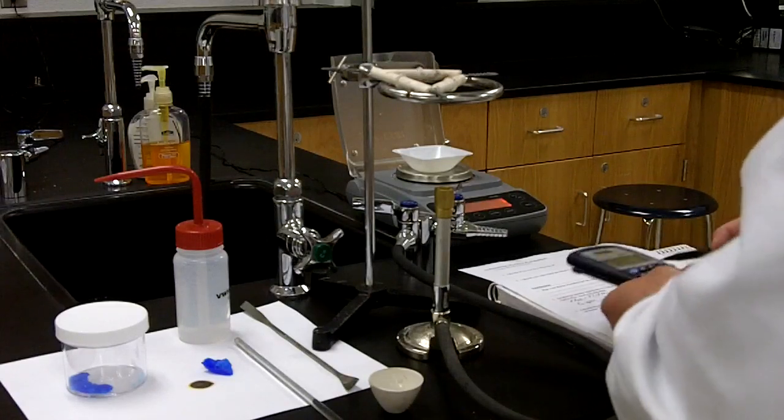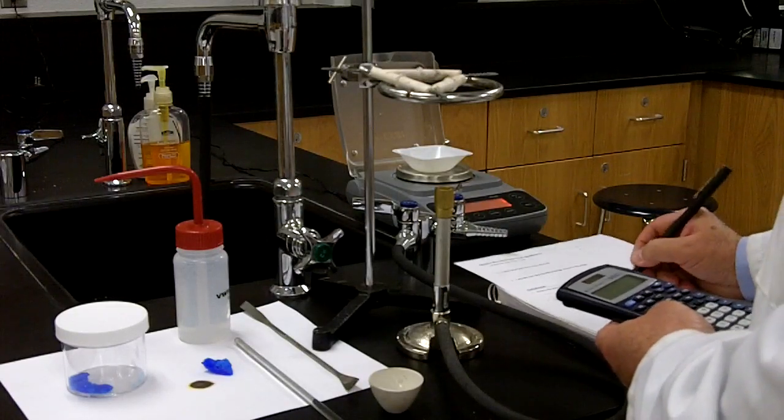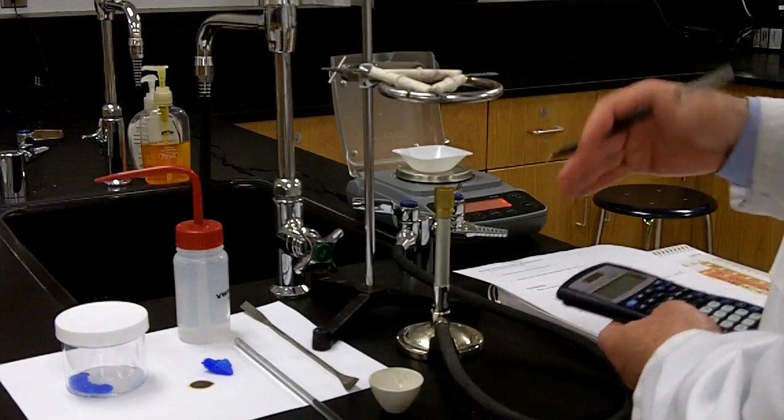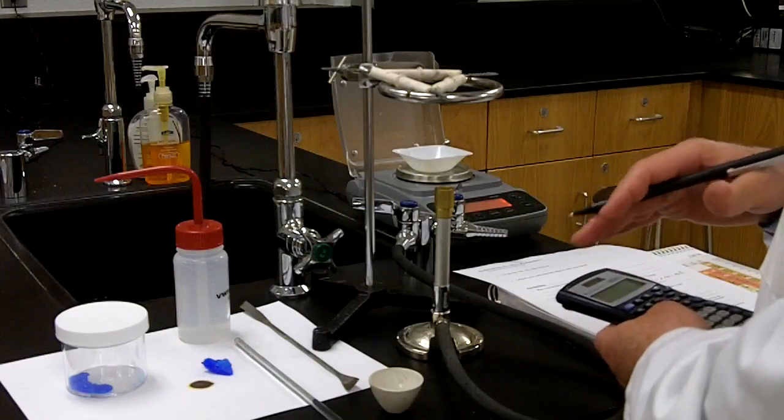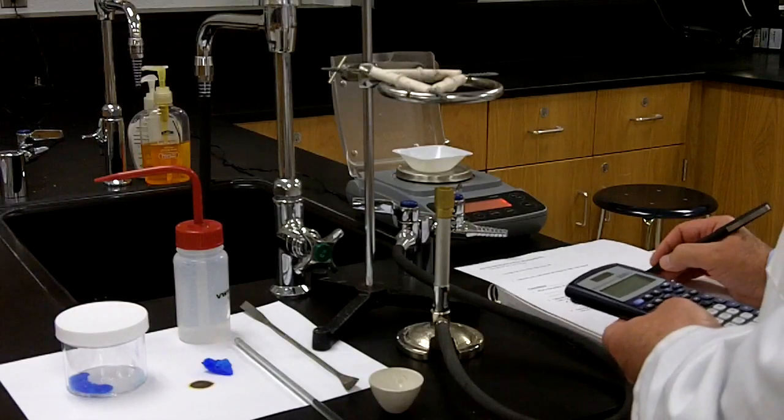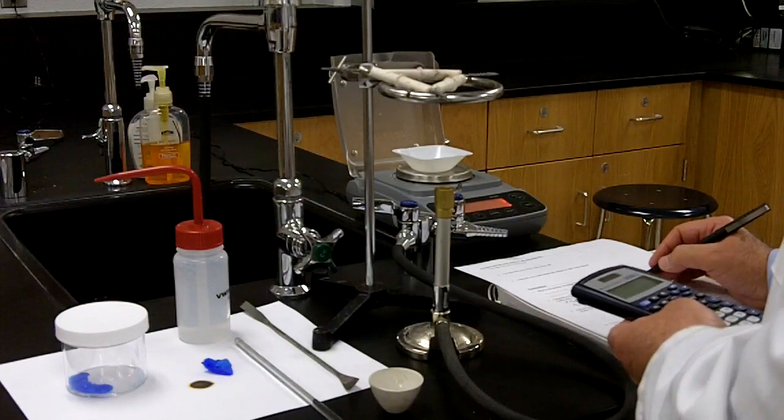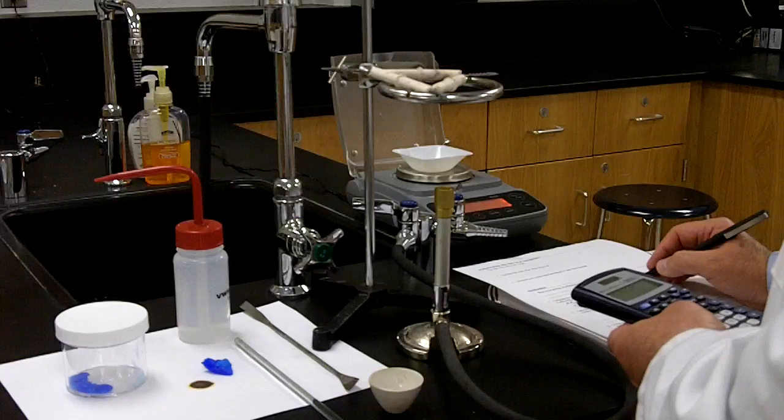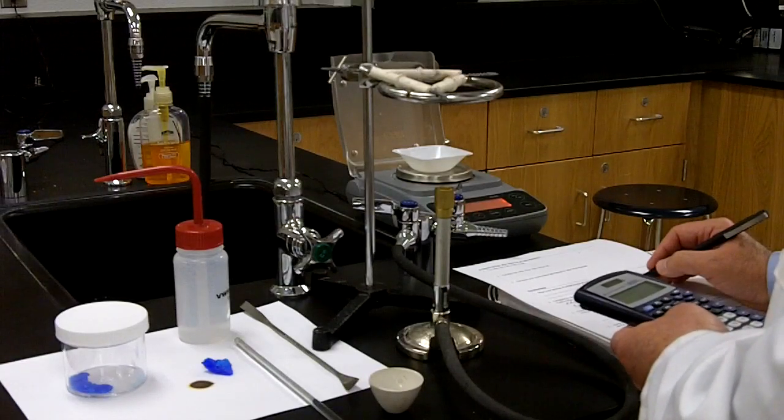So 90.1 then is the mass of just the water alone. I'm in the process of cooling this down. I'm getting experimental data, but I also want to compare that to calculated value. So 90.1 is the mass of the water. That's the calculation that I get.